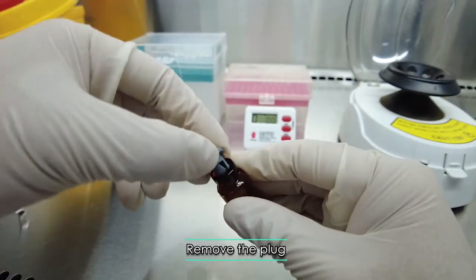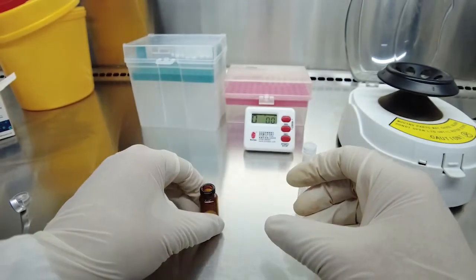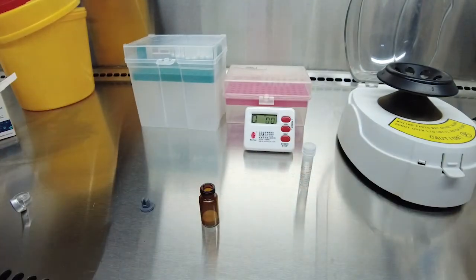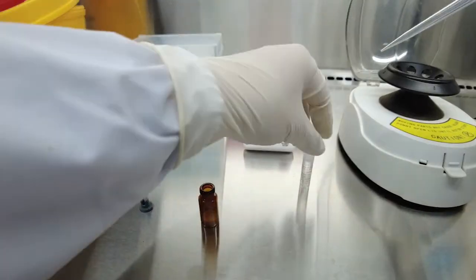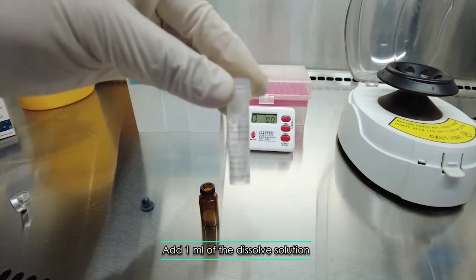Remove the plug. Add one milliliter of the dissolved solution.